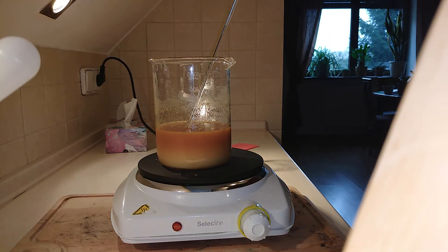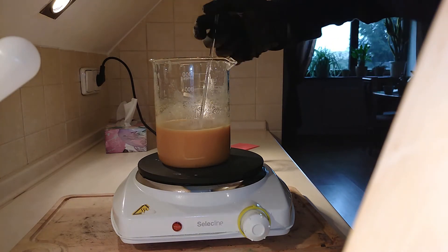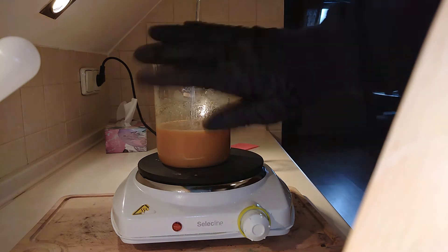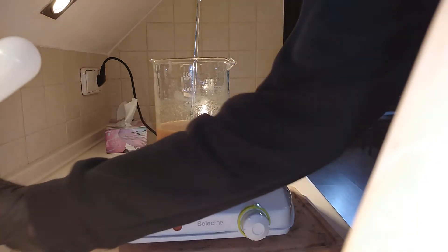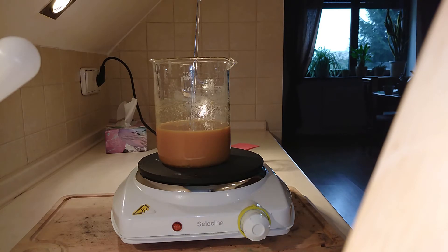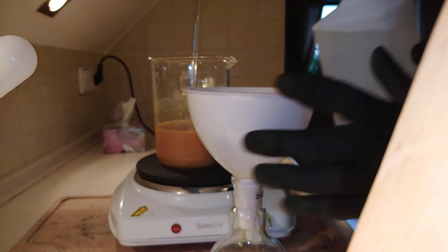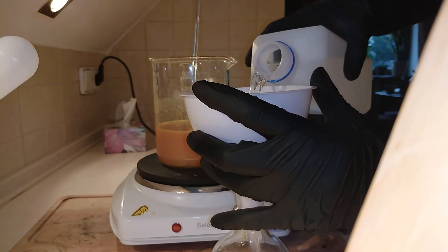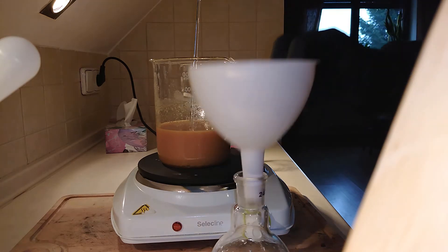This is our reaction about half an hour later. This is our dibenzalacetone suspension. It may look red here, but that's because of bad lighting — it is actually yellow, but not yellow enough. We're going to crash it out. Crashing out is a common technique of precipitating a dissolved substance just by adding another solvent in which it is completely insoluble.